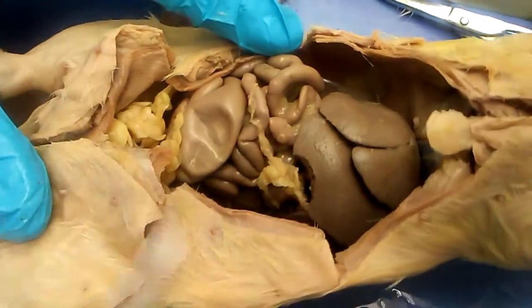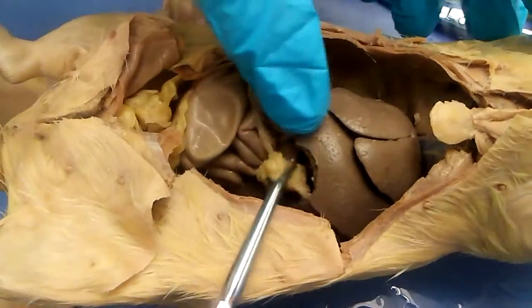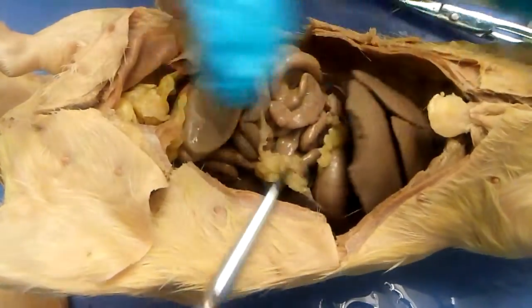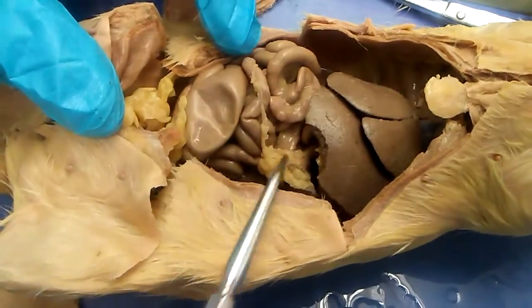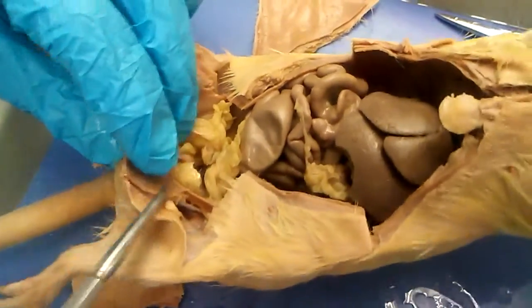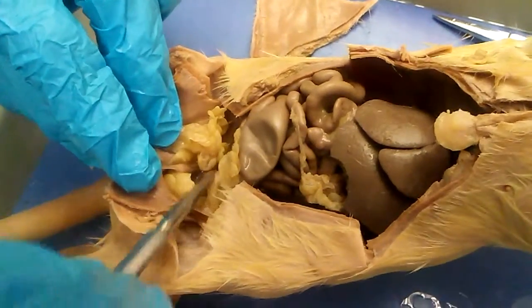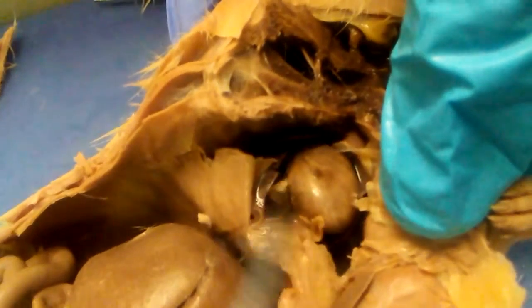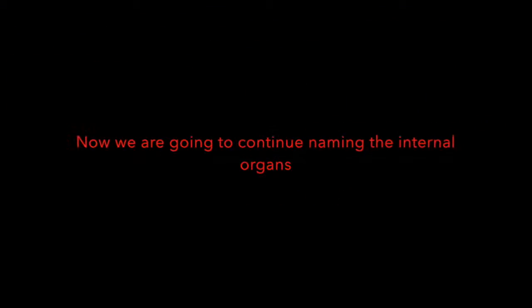Here is the abdominal part of the body, and under this right here you have the stomach, the small intestine leading to the large intestine, and down here you have the reproductive organs. You also have the heart, which has ventricles inside of it — that's the heart — and the lungs are right here on both sides.